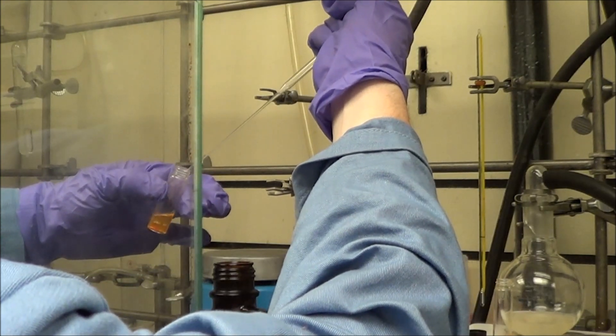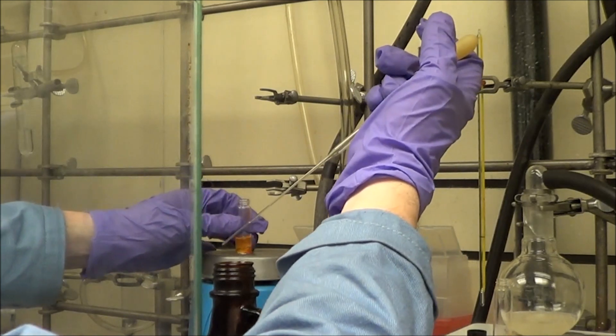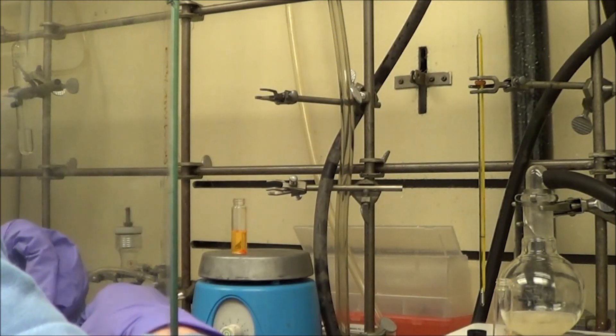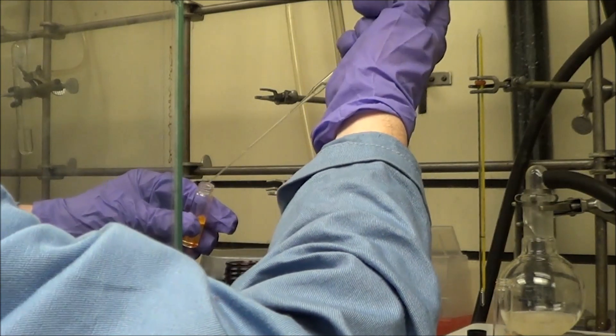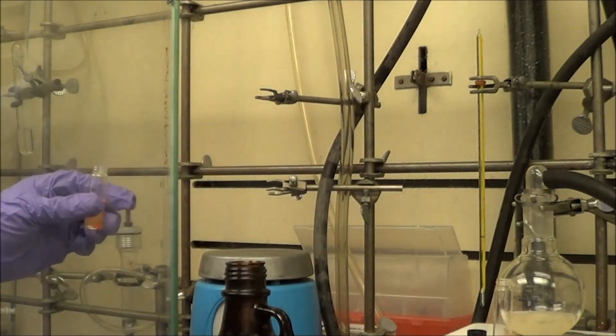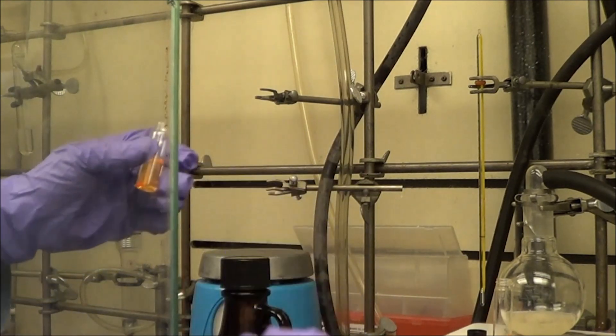If you see that happen, what occurred is that too many ligands fell off in the initial precipitation process, and that you can't fix. You have to start over. Don't add too much non-solvent, that's the methanol or ethanol. Don't add too much if you have this problem, but you will have to start over.